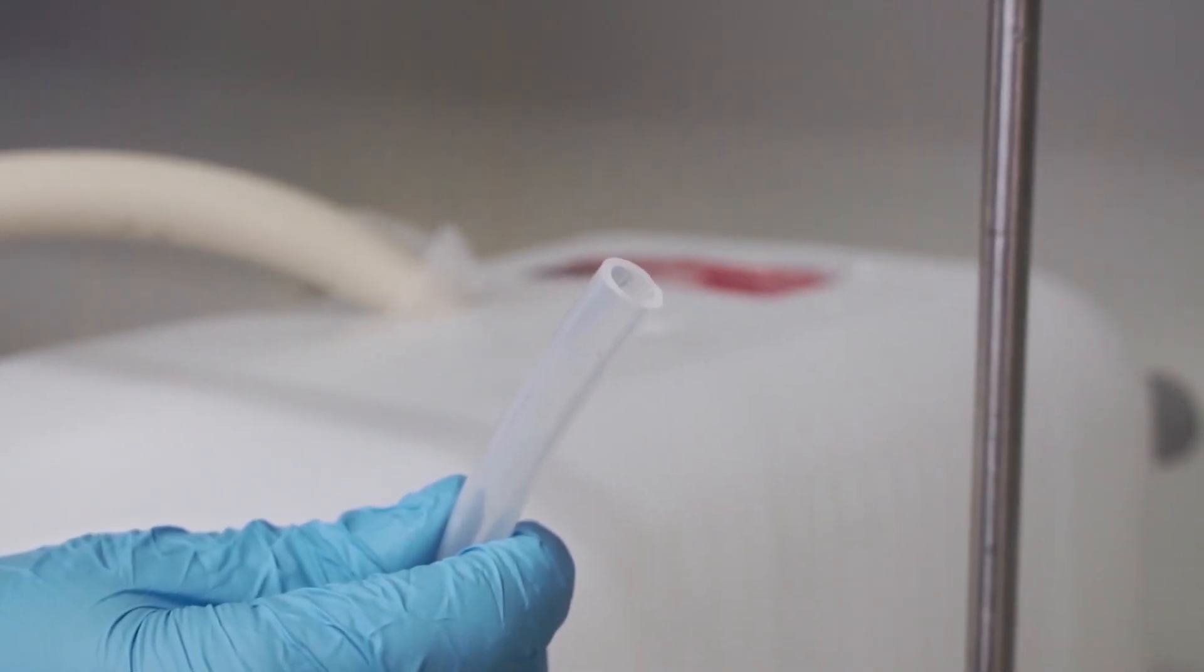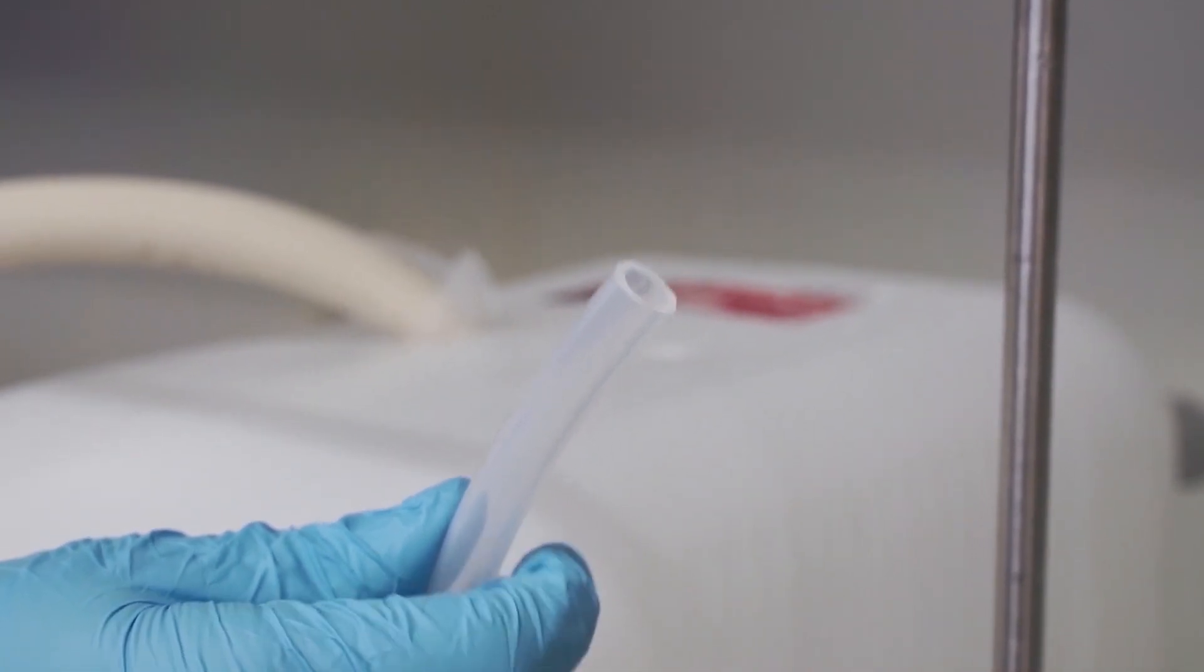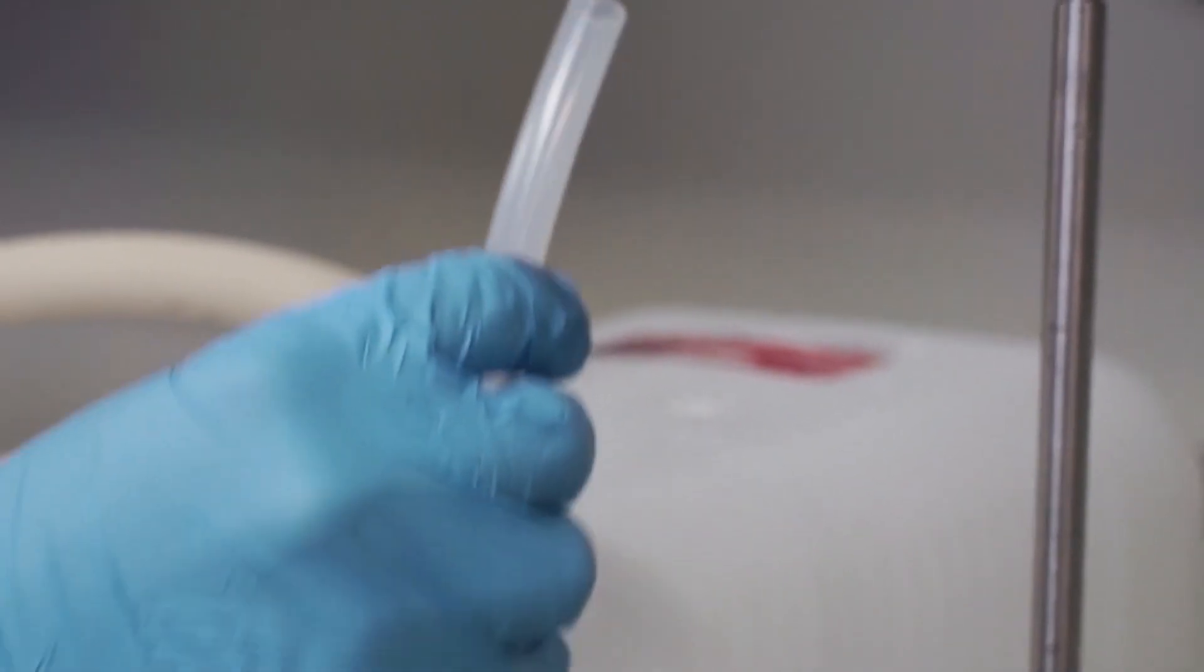Regarding the aqueous solution flow, it is sufficient to follow the operations reported in the alcoholic solution case without the need to add the filter at the outlet of the tube.